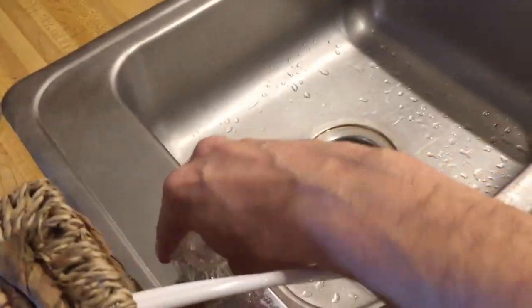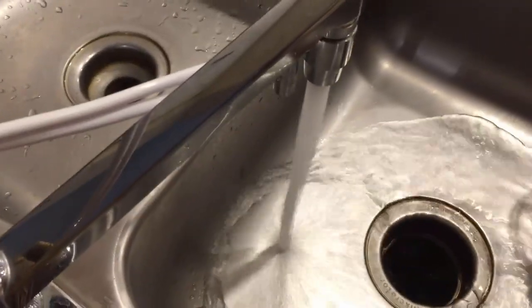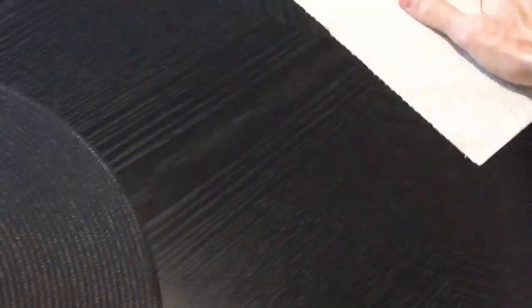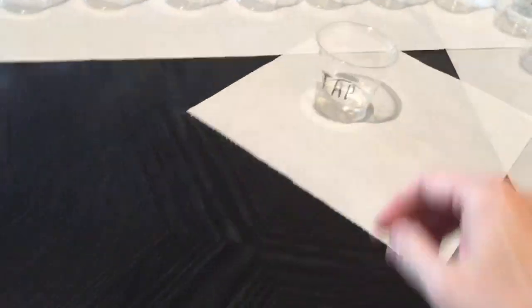Today I'm going to do some testing on pH and TDS levels on bottled water from well-known brands. But before I start, let me get some tap water so we have something to compare it to. I also will check distilled water to compare it to tap water.